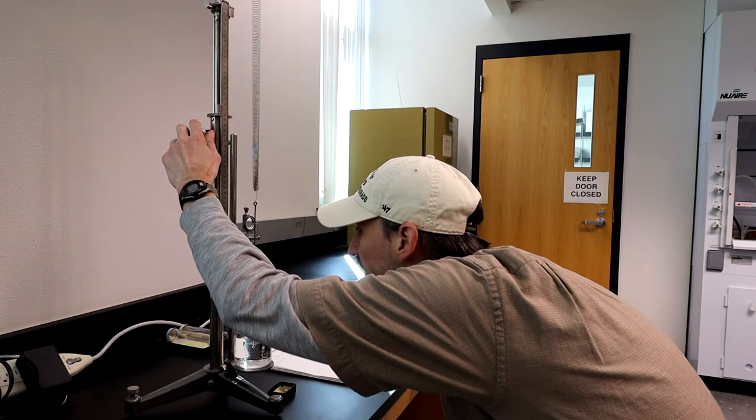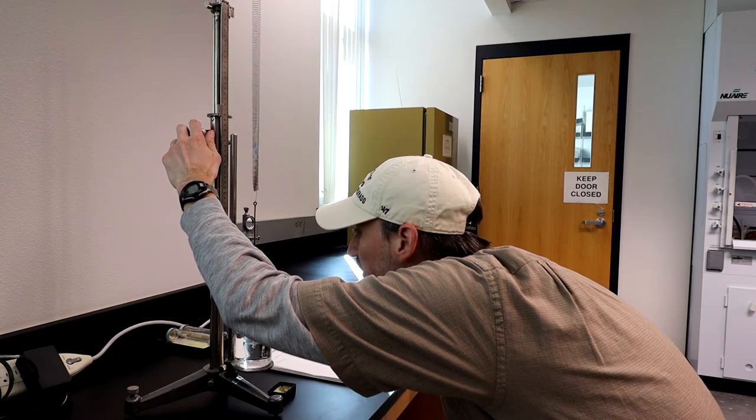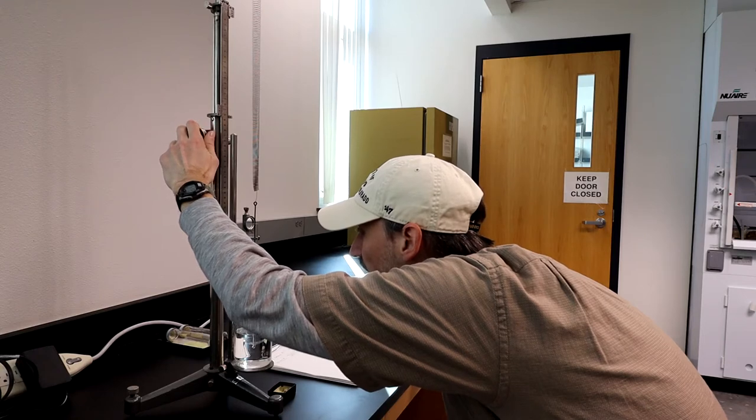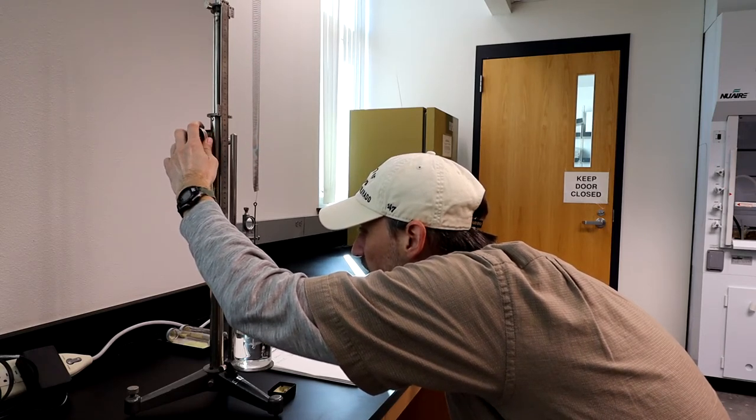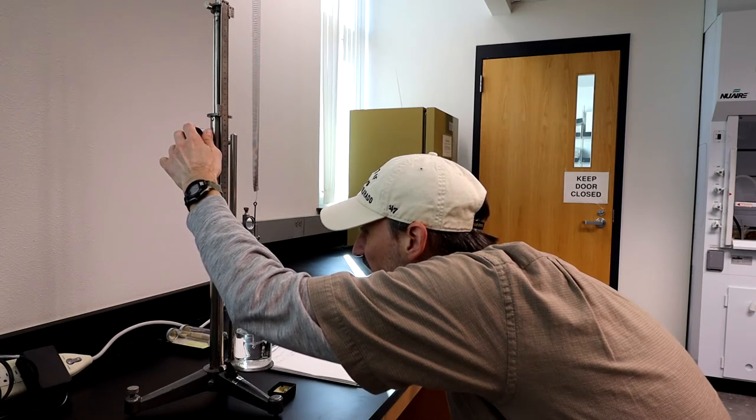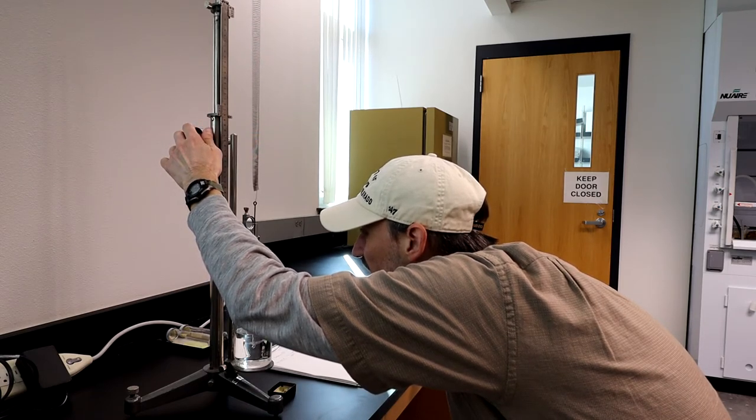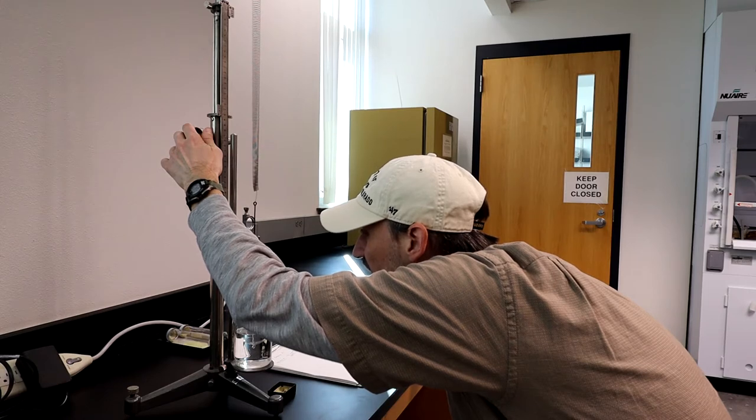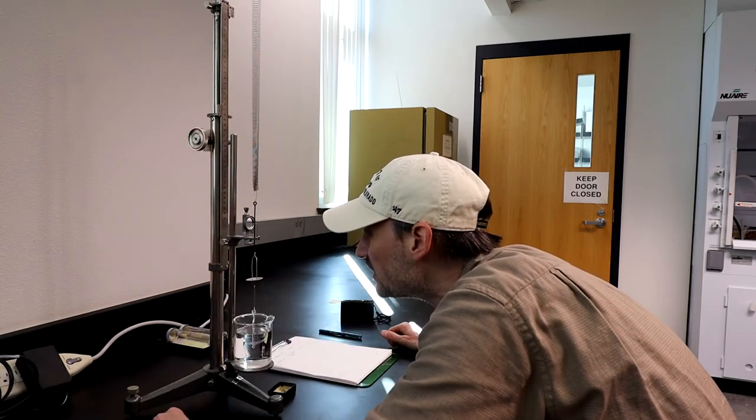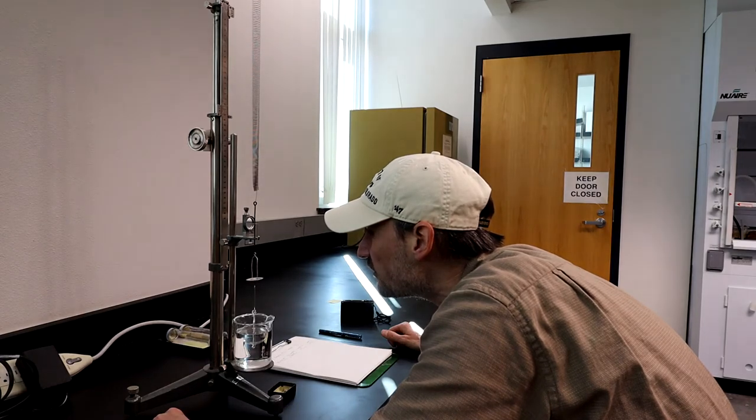I'm going to get down low. I can see my eye in the mirror, the line is going right through horizontally to the center of my eye, and I'm now slowly moving this knob up and down until that platform is exactly aligned with the line in the mirror, which is going right through the center of my eye.